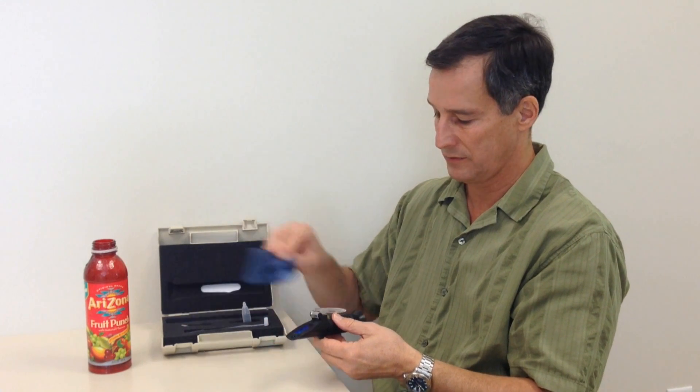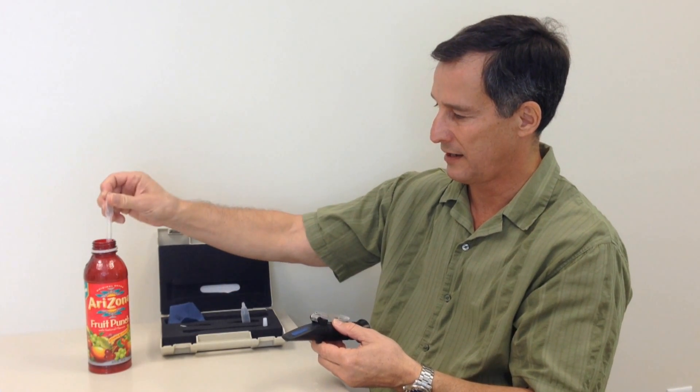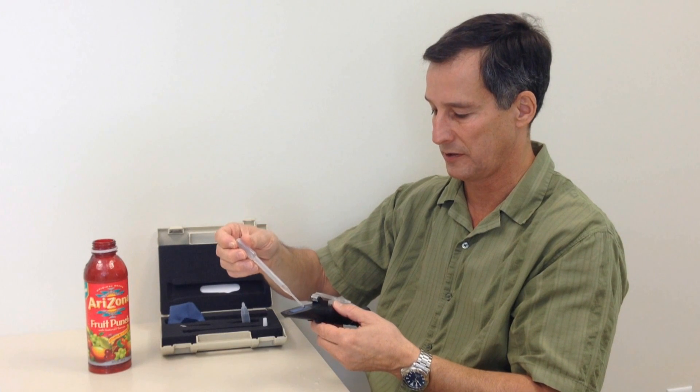I now clean off the prism and will measure some fruit juice. Same thing: I take just a few drops and put it on the prism.